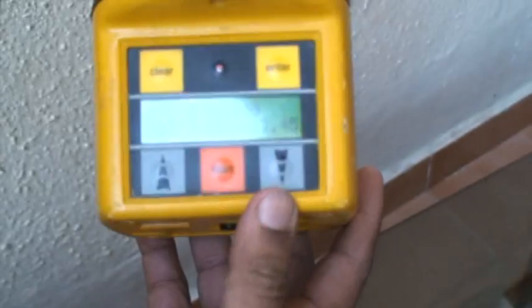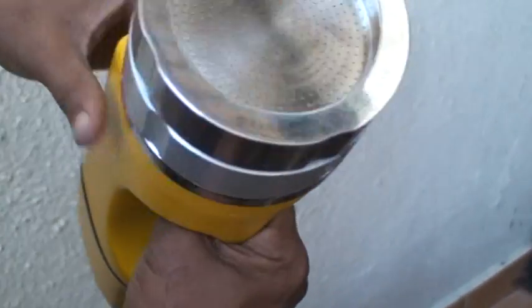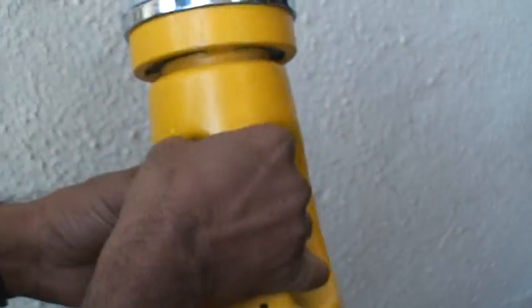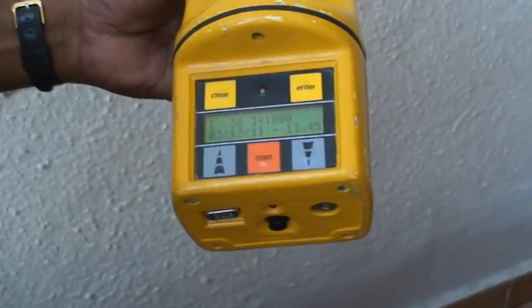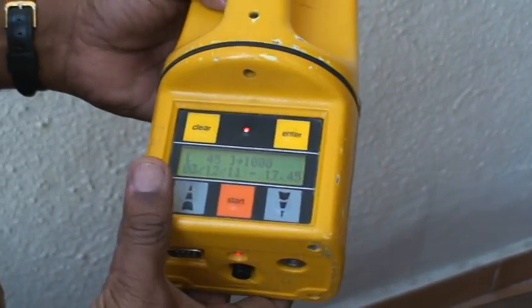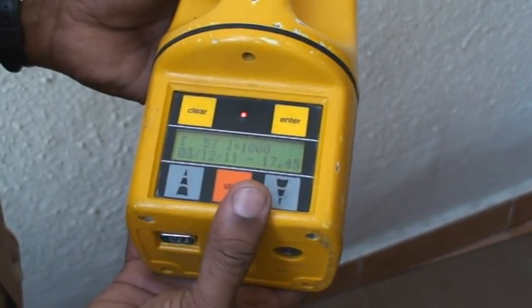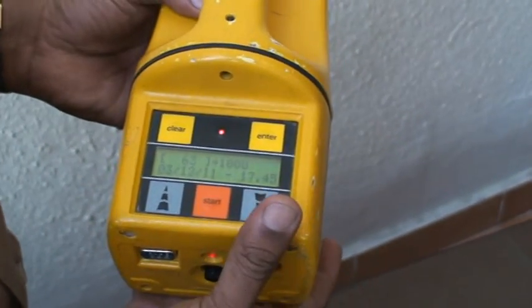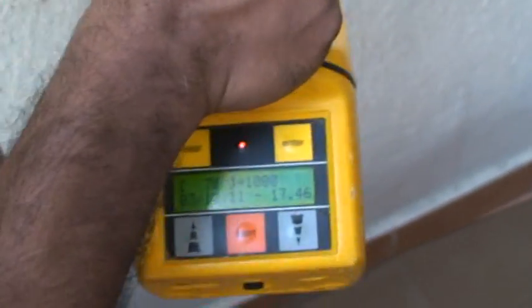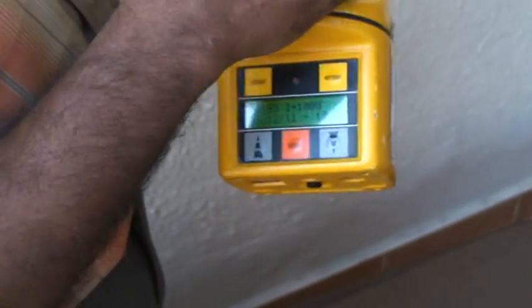To start, just press 'start' — you can hear the pump starting. It is sucking microbial air from the clean room. It is set at 1000 liters, running at a rate of 100 liters per minute, so it will run for 10 minutes. You can also program it to 180 liters per minute.